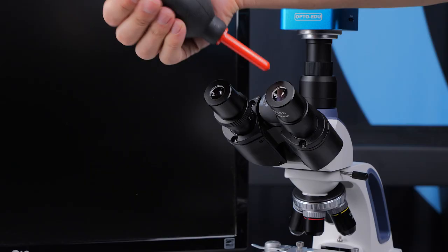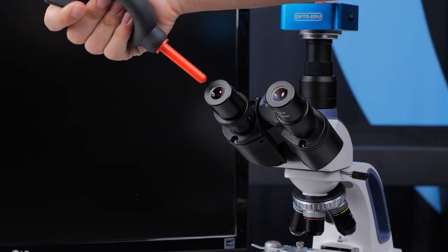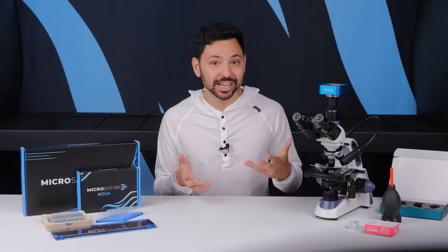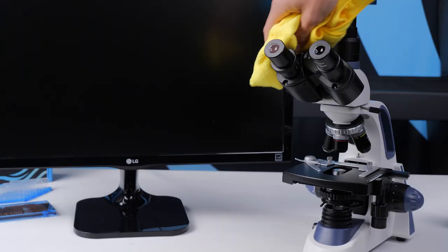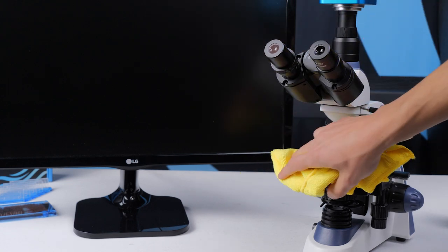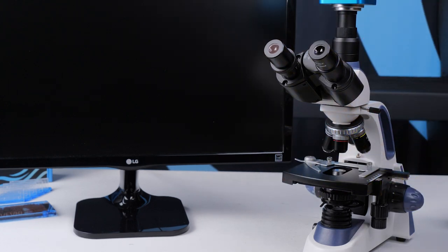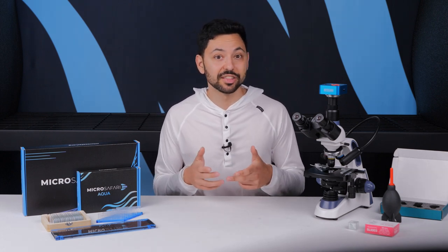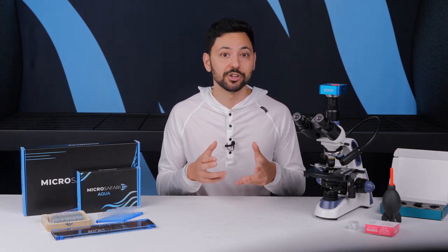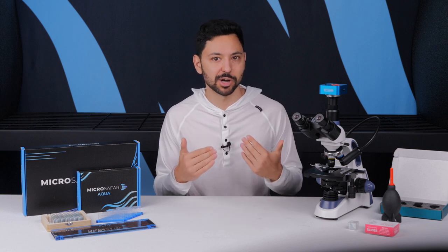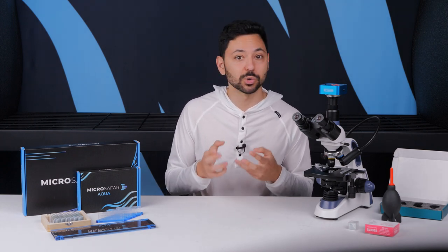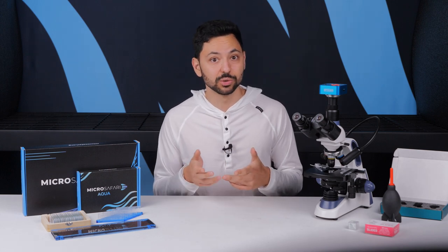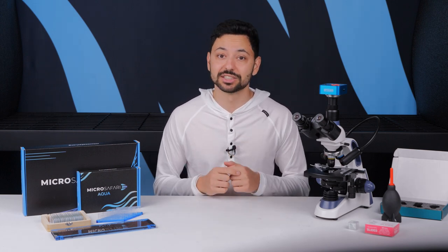Removing dust. You're certainly welcome to use the rocket air duster to remove dust from your lenses on your microscope as much as you want. There's not really any harm to doing extra dust removal. You can use a microfiber cloth to remove dust from all other places on the microscope that aren't lenses. You'll note that modern microscopes have optical systems that are designed to keep dust from interfering with image formation as much as possible. There are only really a few spots where dust will create shadows in the final image. If you're seeing shadows of dust when you look into a microscope there are a couple places to check.